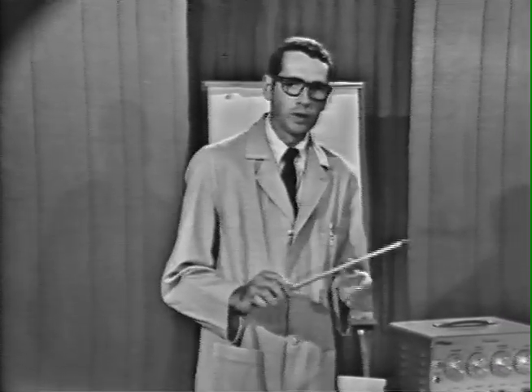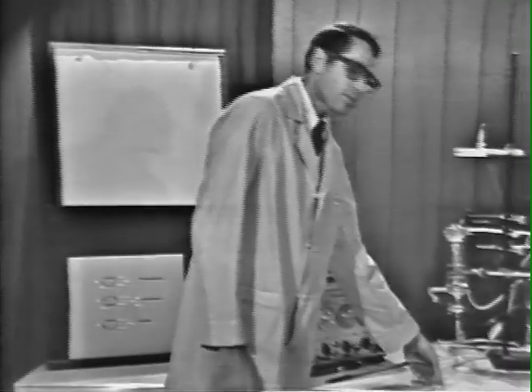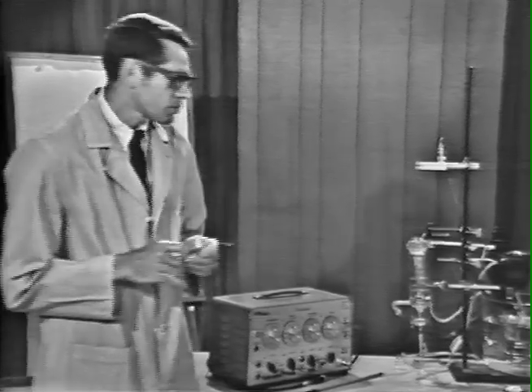Now, we have prepared a fresh atrial preparation for this portion of the experiment. It no longer has the nerve tissue, and you're probably able to get a better view of the contraction of the atria. Now, for the first injection, we will give sufficient norepinephrine directly into the bath to obtain a concentration of 1 nanogram per milliliter within the tissue.